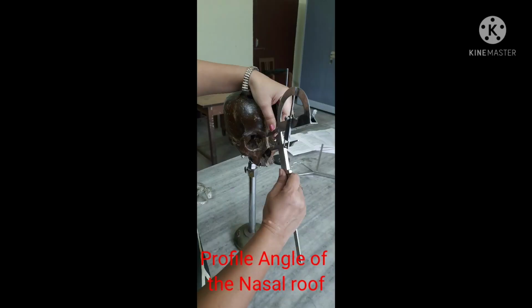Profile angle of the nasal roof. This angle measures the inclination of the nasion-rhinion line over Frankfurt horizontal. The points of the goniometer rest on the termini of the line from nasion to rhinion. This measurement should be taken only on skulls having complete nasal bones.